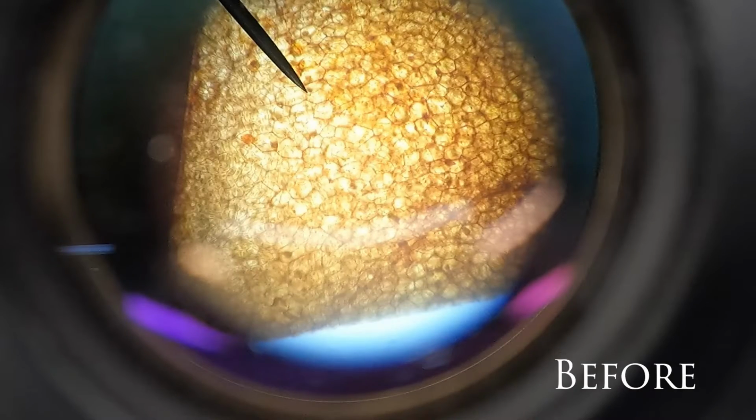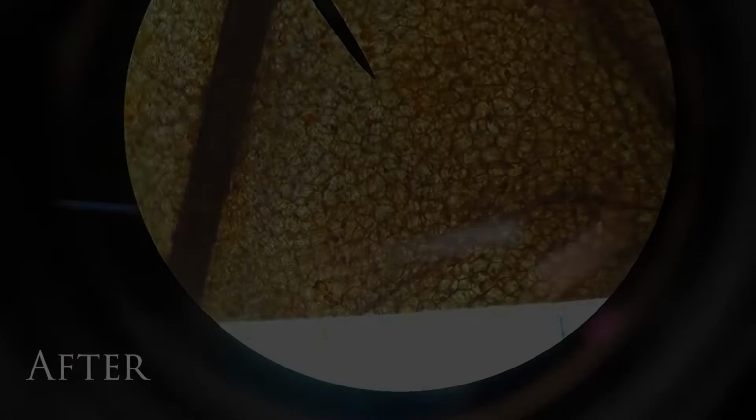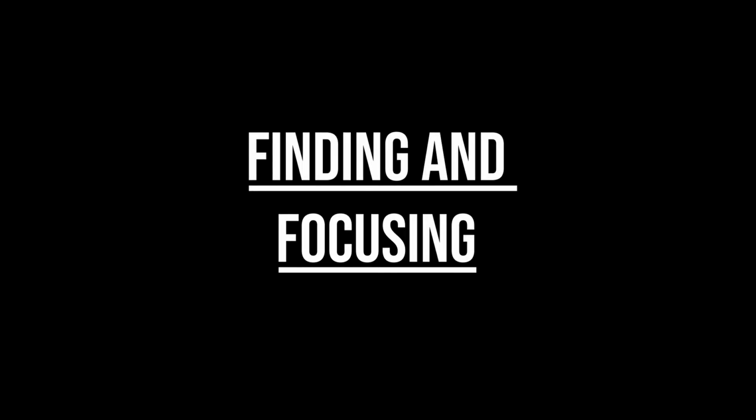If at this point your image is still not sharp, you can focus using the fine adjustment knob. Finding and focusing on a specific part of your sample can be difficult. If you are struggling, here are a few tips that can help. Always start focusing with the lowest power objective and work up to the higher power objectives.